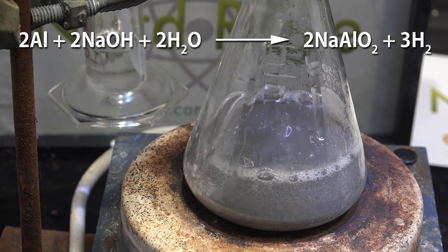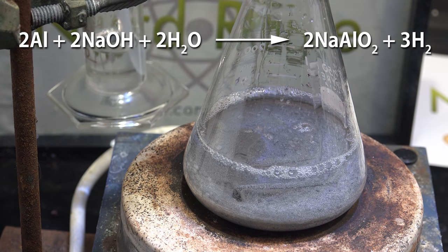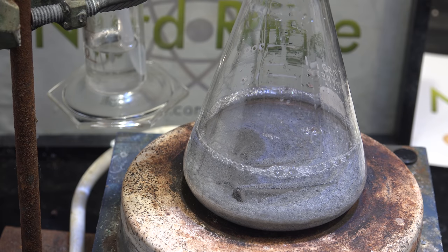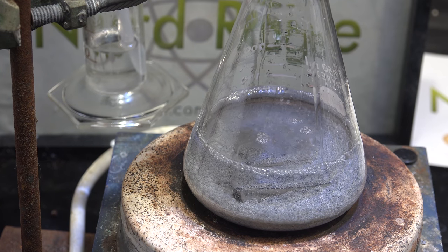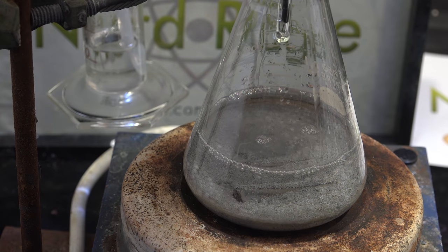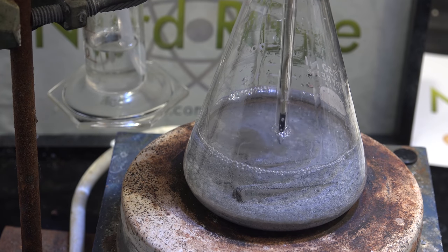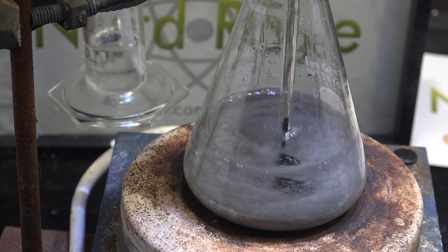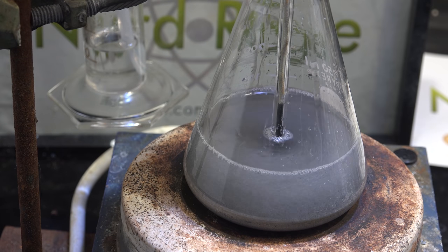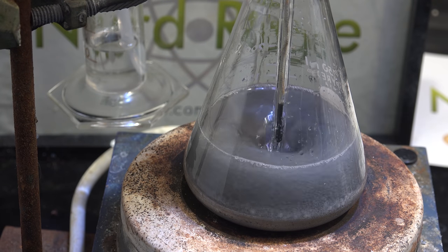Although it does deplete some sodium hydroxide so it will probably have less yield. Anyway after mixing in aluminum metal, sodium hydroxide, mineral oil and tertiary alcohol I inserted a digital thermometer and began heating. I'm using an internal thermometer now to better track the internal temperature of the reaction mixture and make my results more reproducible.